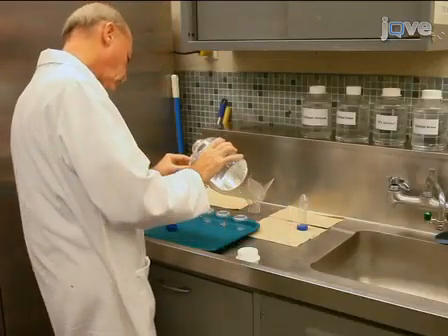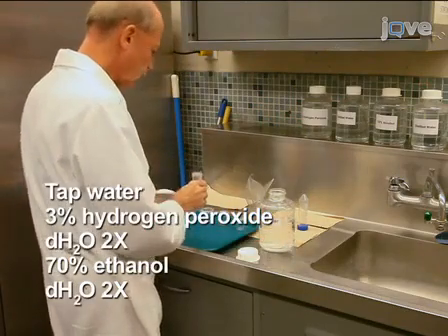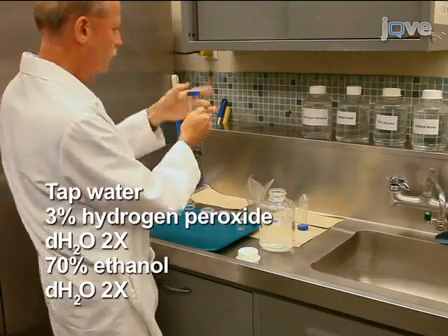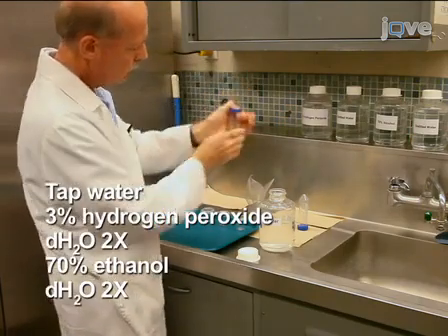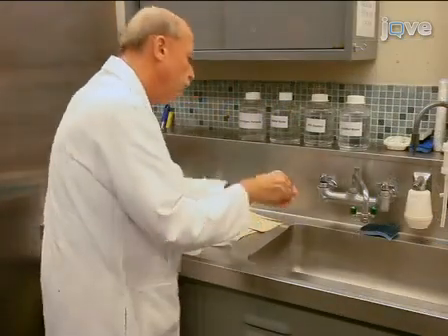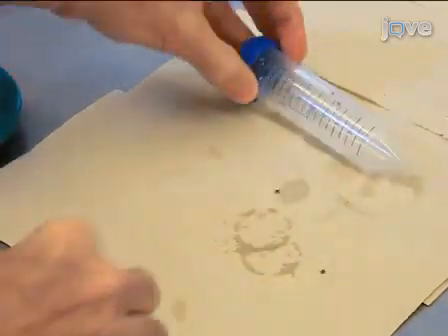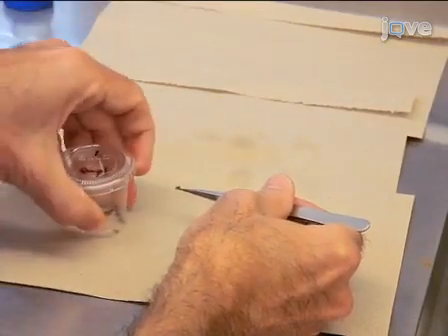To prepare the ticks for injection, first wash the ticks in the following series of solutions: tap water, 3% hydrogen peroxide, distilled water twice, 70% ethanol, and 2 final washes with distilled water. Perform each wash in a 50 milliliter disposable centrifuge tube by shaking, then decanting the solution through a fine mesh wire screen. Blot the ticks dry on paper towels. Then, aliquot the ticks into groups of 20 to 50, depending upon the experiment.